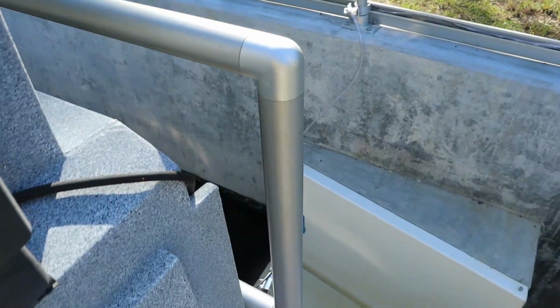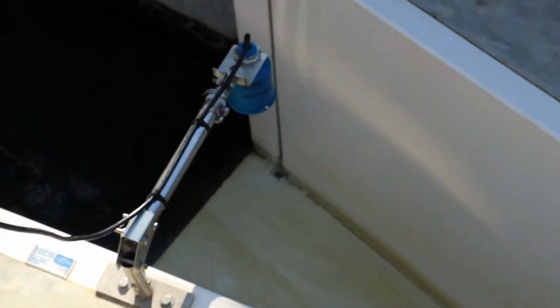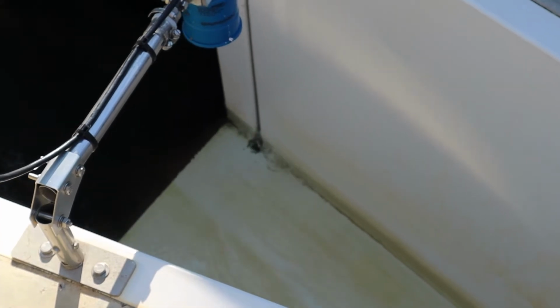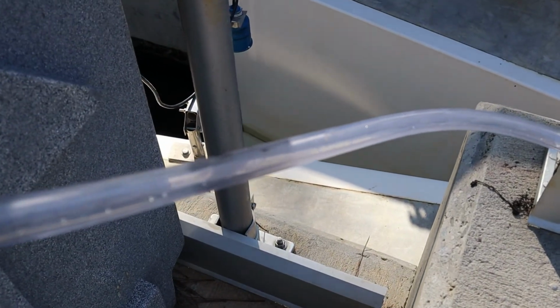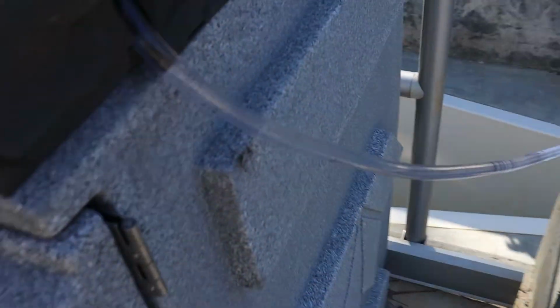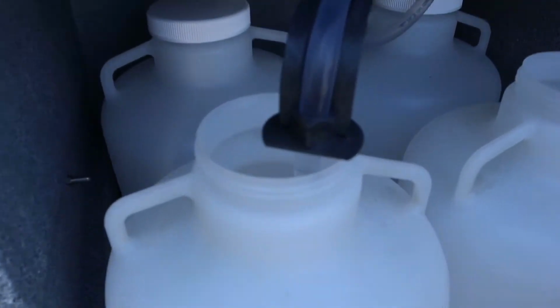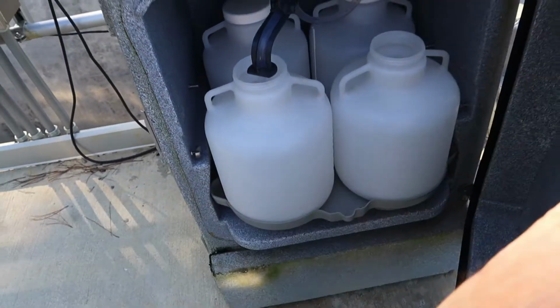So when I hit enter, you're going to hear that pump come on, and you're going to see way down there, it's purging the line. That's actually pushing air back through, and it's bubbling up right there. Alright, so now we're actually pulling a sample. Let's get you right here on the hose. You might be able to see the sample come through. And there it goes, pulling the sample. And it's actually going into the carboy there.